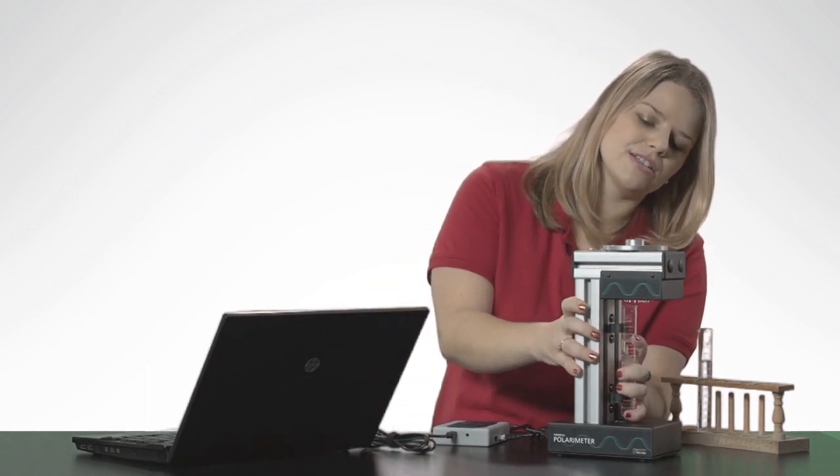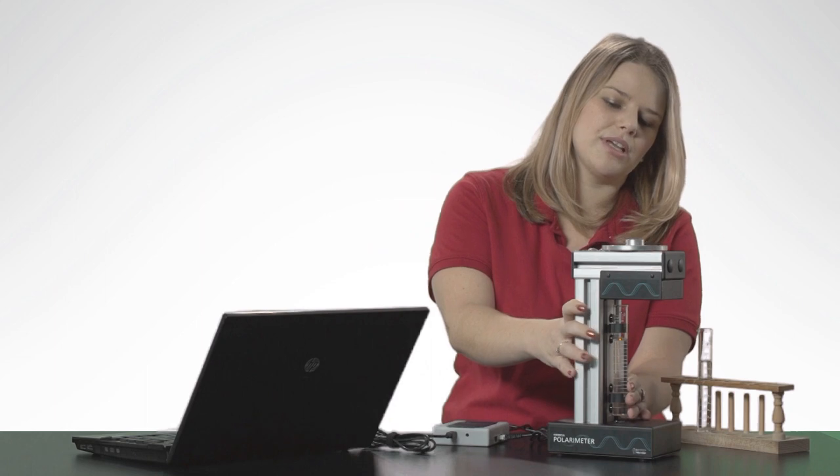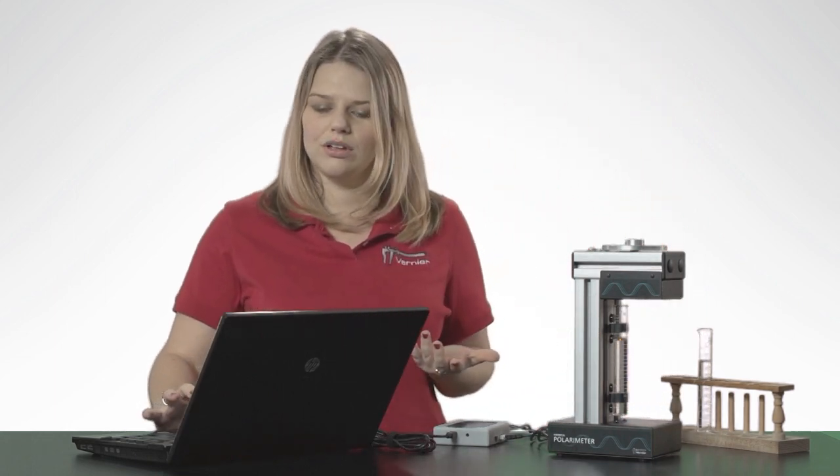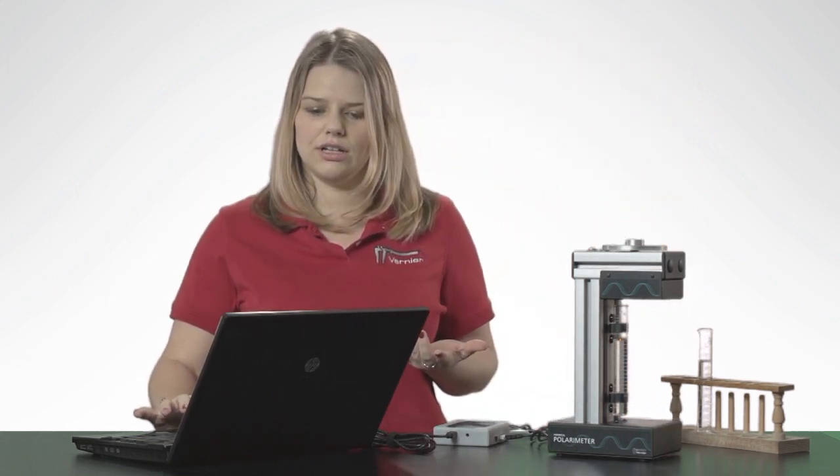Place the sample into the polarimeter, snap it into place, and now start data collection in Logger Pro.